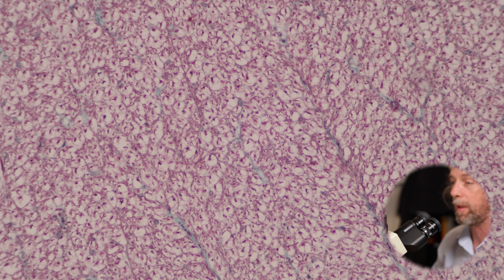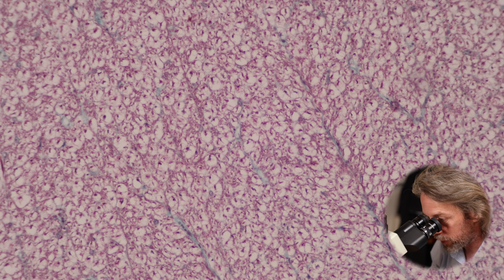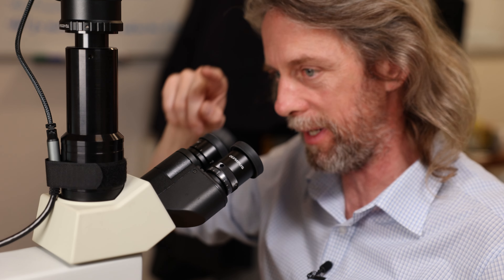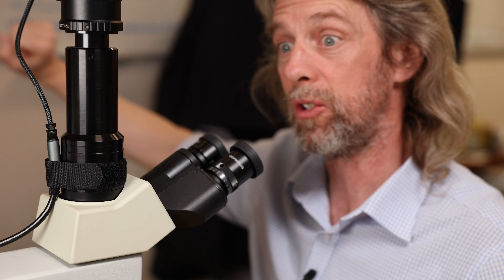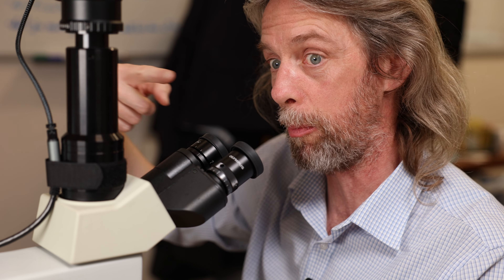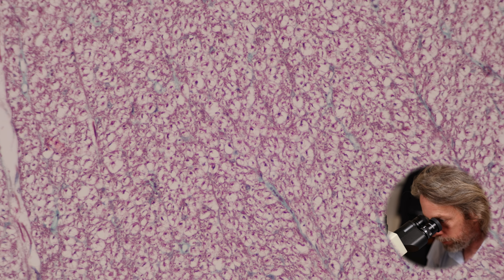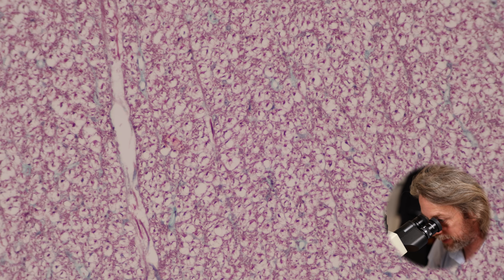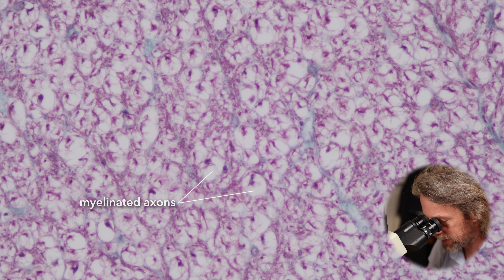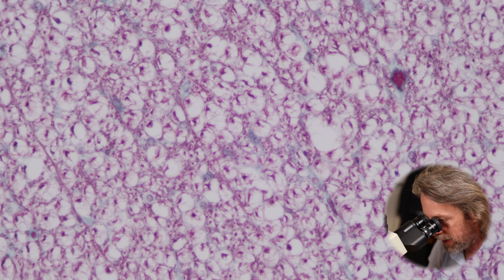What we're looking at in the white matter is lots of axons running up and down the spinal cord that have been cut through — we're looking at transverse sections through axons. Remember, the neuron has a cell body and sends off a very long process. It sends action potentials along that axon. If signals go away from the central nervous system, it's a motor neuron; if coming back in, it's a sensory neuron. The axon is surrounded by myelin, which in this case is made by oligodendrocytes — we talked about Schwann cells in the peripheral nervous system and oligodendrocytes in the central nervous system.